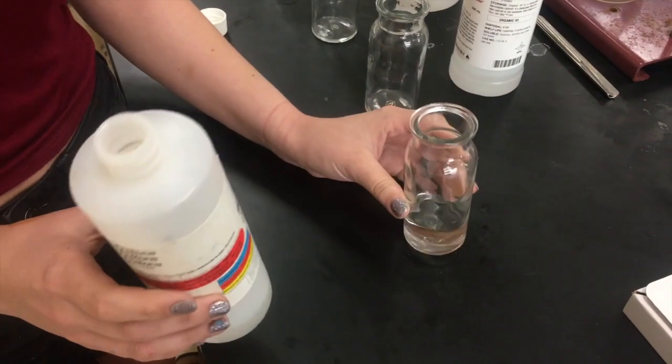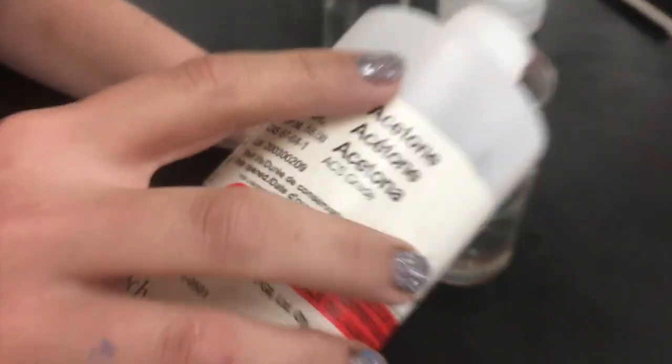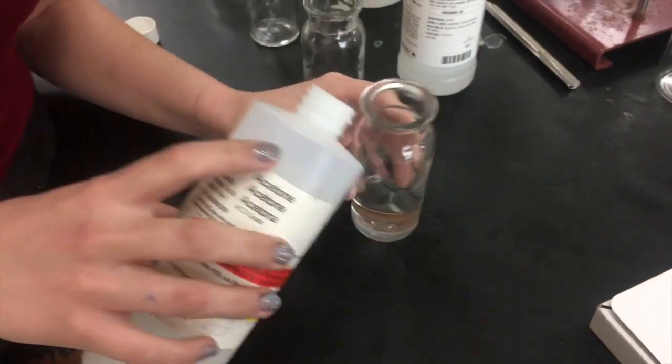Okay, so for this experiment, we chose to use four different solvents. You don't need four, but we thought that you'd have a nice variety of results this way.